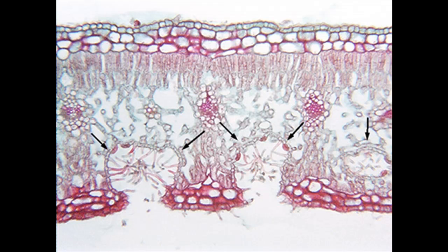Okay, here's one more. This one seems a little bit more messy. And if you get something like this, this would be an unfamiliar structure to you. You'd be looking at this going, oh, what's this? If you got that structure and it looked unfamiliar, just draw it, but don't label it. You've got to draw what you see there, but if you're not sure what you're looking at, label the things that you are sure that you're looking at.